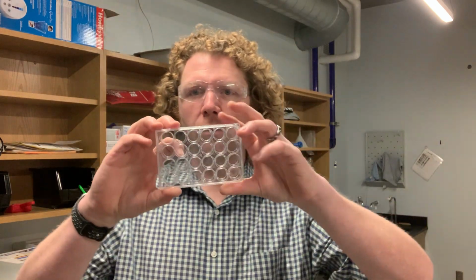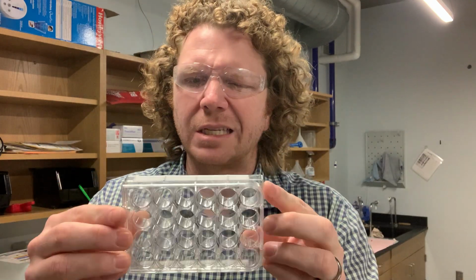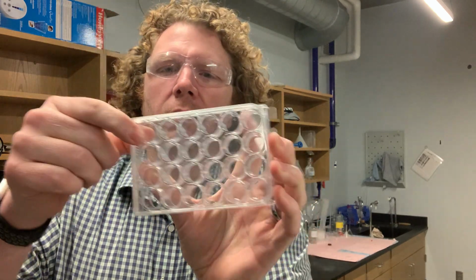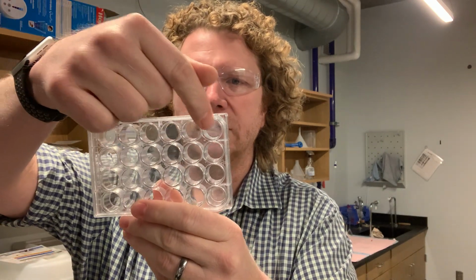So in both parts of this experiment, you will actually not have any glassware. You won't have a bin with any glassware, but instead, everything that you're going to be doing is done in these 24 well plates. This is kind of the same material as a Petri dish in a biology lab. It's this kind of hard plastic. There's 24 wells in here, 1, 2, 3, 4, 5, 6, and then there's 4 rows of them, so we have a grand total of 24 wells.